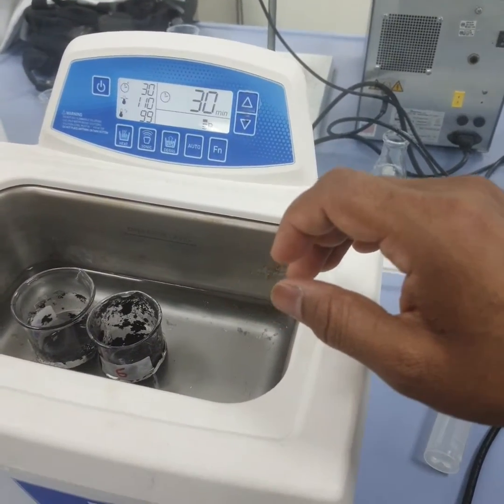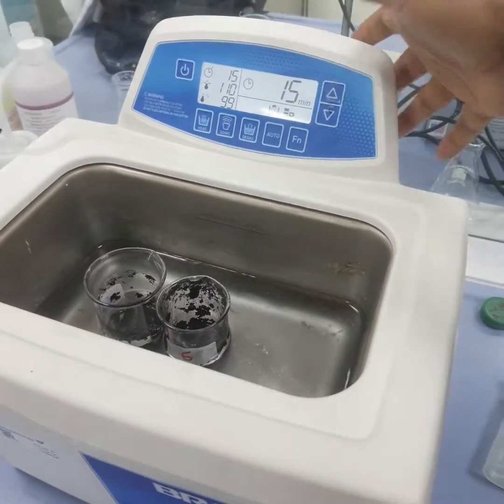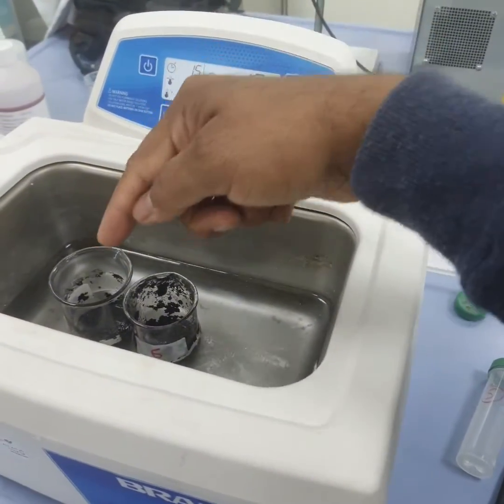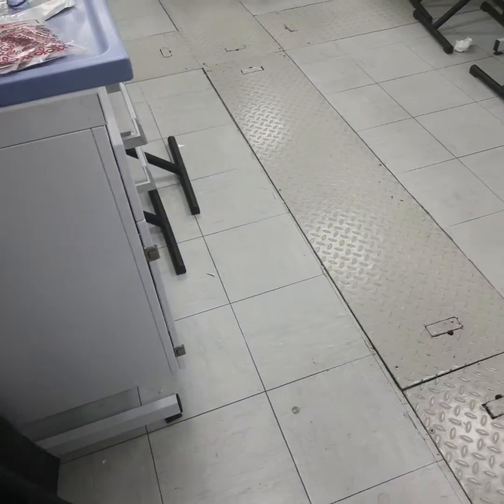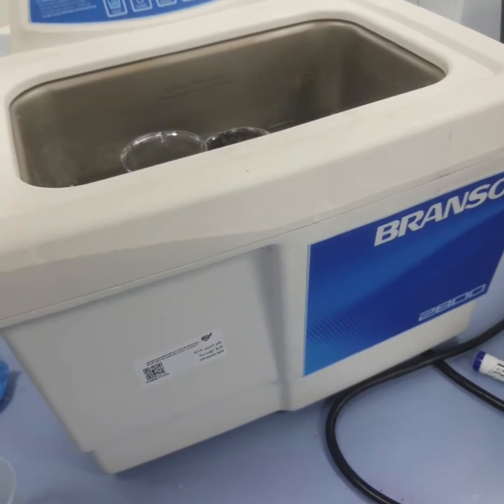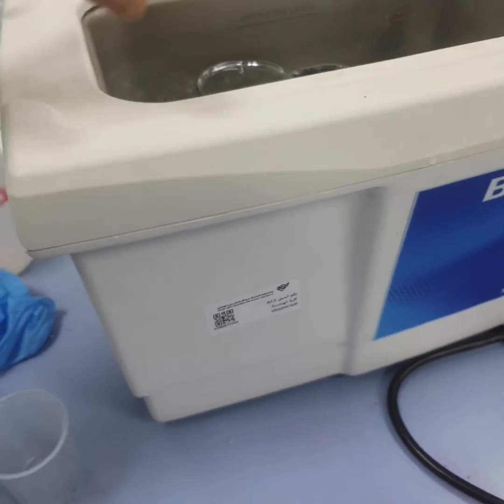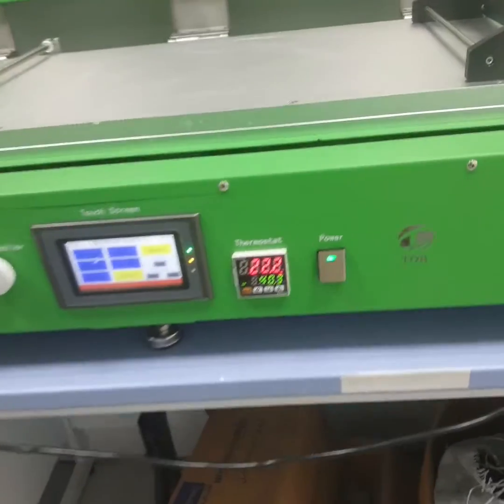Now, after that, these assortments are ready, so we need to degas. It will depend upon the volume of the assortment that you have. Suppose it is 20, so you will be degassing 20. You have ultrasonicated the activated carbon, then you have added the polymer into the DMF after the ultrasonication, you added them together. Now after the assortment is ready, degassing is done. Just pat dry the plate.